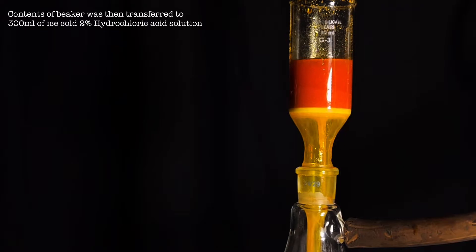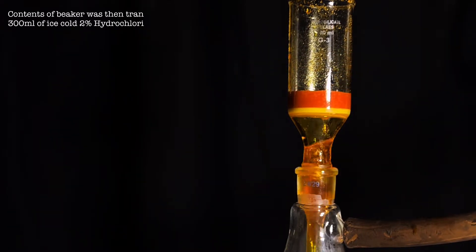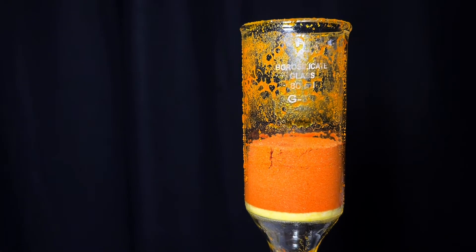Once the precipitate is formed, it is vacuum filtered. The crude product was then washed with some ice-cold water. This is the crude product after filtration.